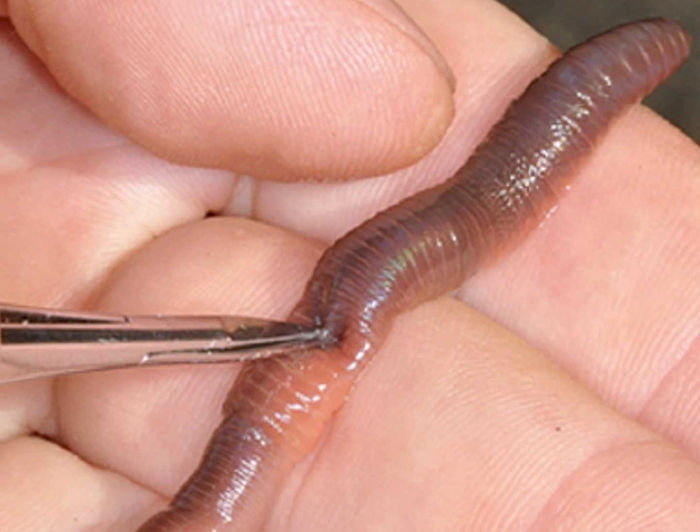For the morphological features, we have to dissect the earthworm, and for dissection we have to use the wax bottom dish and small pins for attachment, and a magnifying glass for observing the internal structures. We could anesthetize the earthworm in 10% ethanol if required. Then turn the worm dorsal side up. We cut invertebrates from the dorsal side because they don't have any vertebral column.